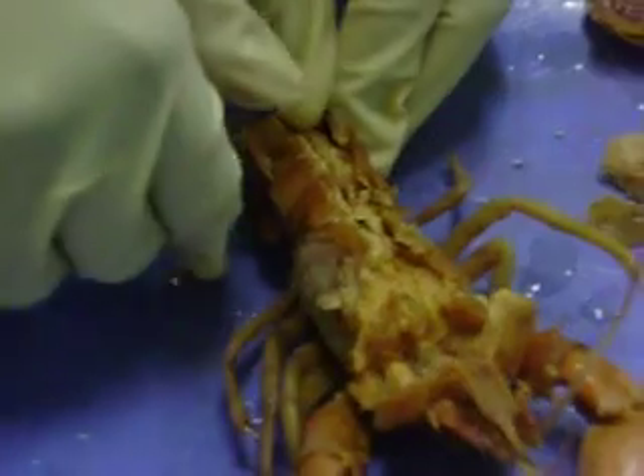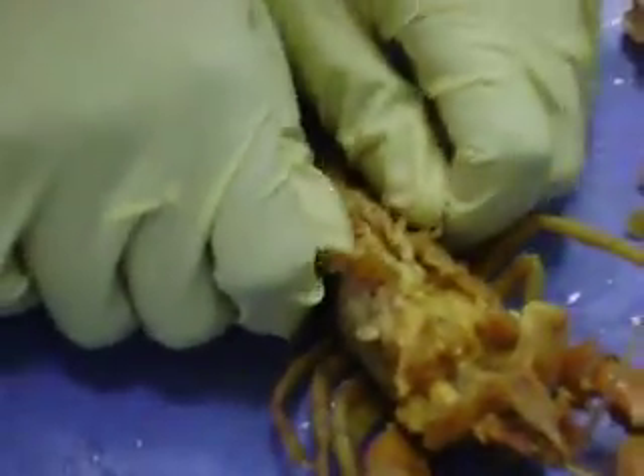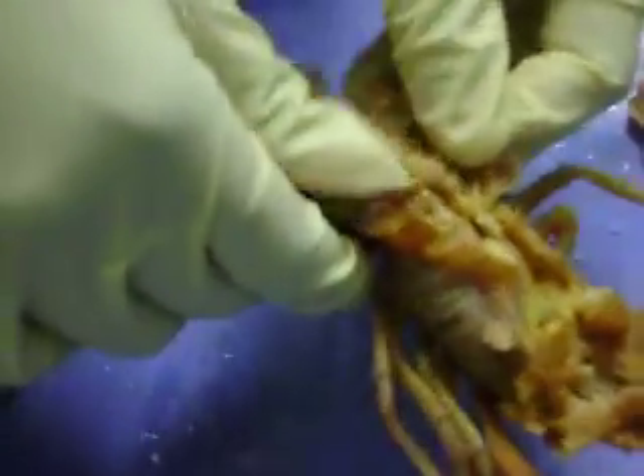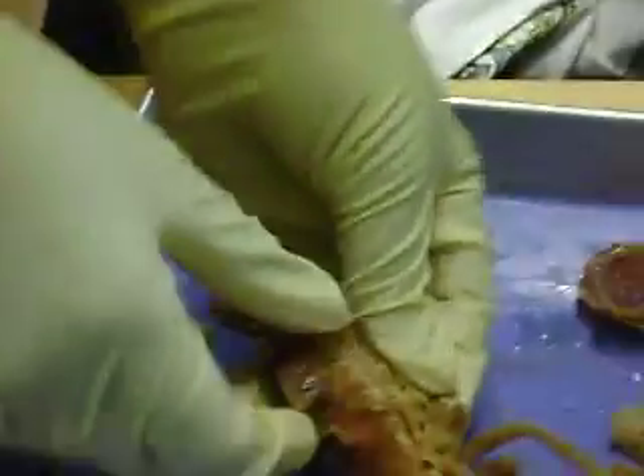Don't eat all the stuff up there, it's not good. Give it to the dog — they'll appreciate it more. Give it to the seagulls. Here on the side, that's the muscle. This is what I thought of as shark feet — it's tough, pretty hard.